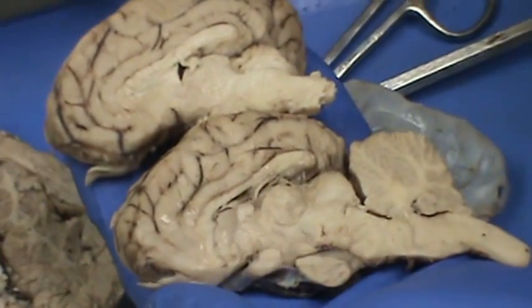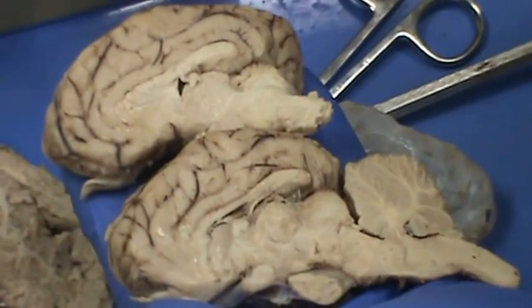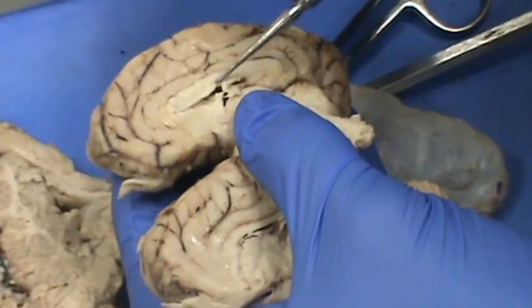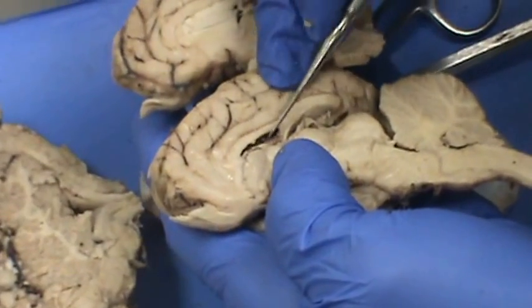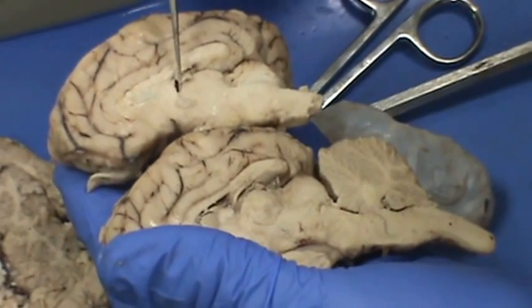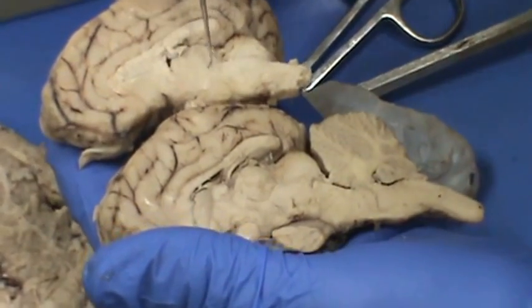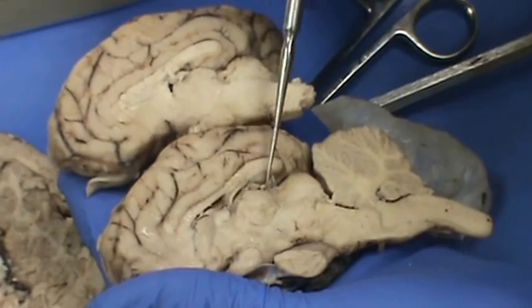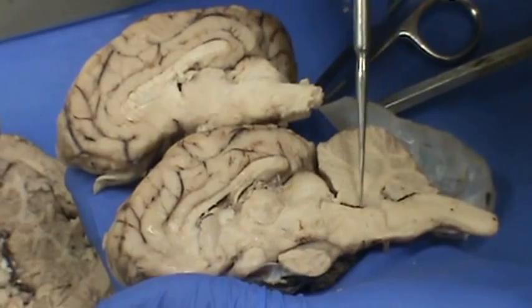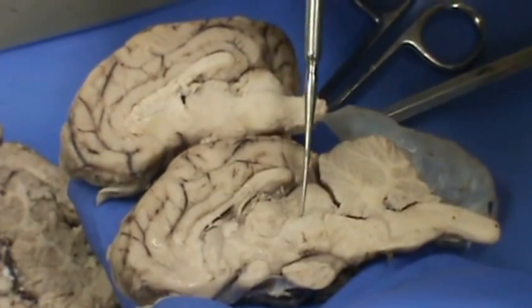For those of you in lecture, remember that the corpus callosum is a type of commissural fiber — it's the largest commissural fiber. Looking at your ventricles: the right lateral ventricle goes around the corpus callosum. You have the thalamus here. The third ventricle surrounds the thalamus. The fourth ventricle is between the cerebellum and the brainstem. The aqueduct of sylvius flows right here — you can kind of see a line there.